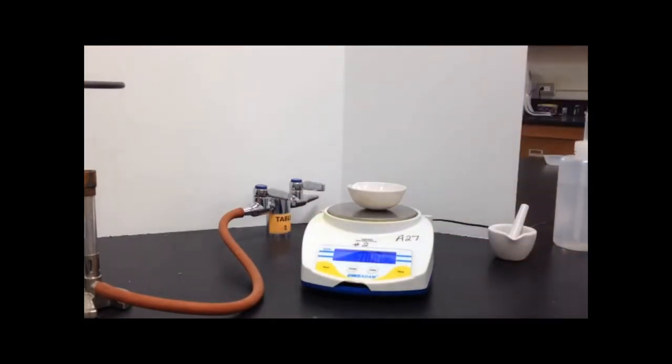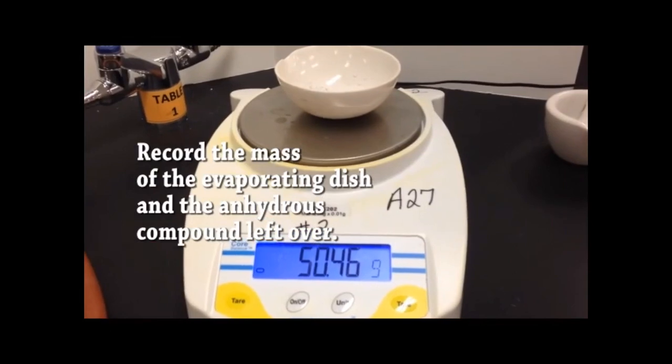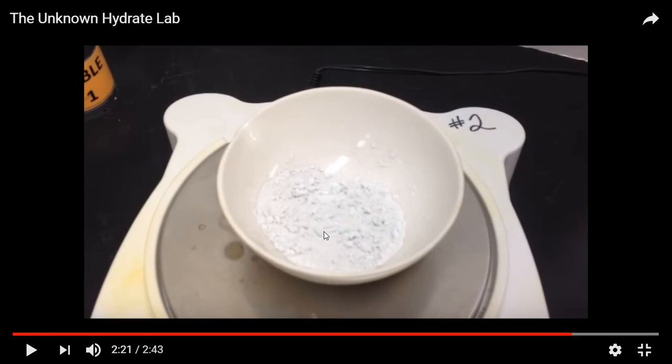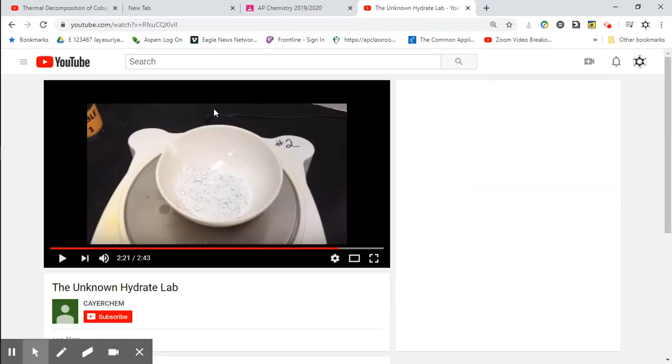So it was 54.76 before, and now it's 50.46. So that means before you heated it up, it was the hydrate, which means it contained water. After you finish heating it up, all the water has evaporated and now it's 50.46. That means all the water that evaporated, you can find its mass by taking the mass of the hydrate before you heated it and now the anhydrous version of that hydrate after you've heated it. Okay, so now you can do calculations based on what you just did.